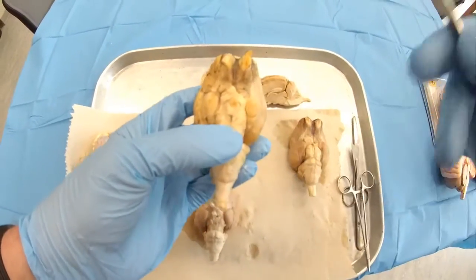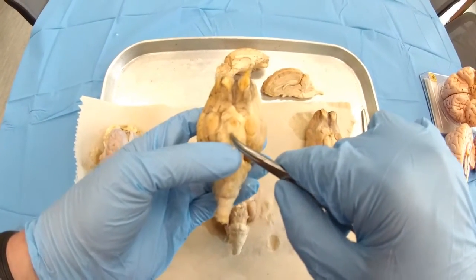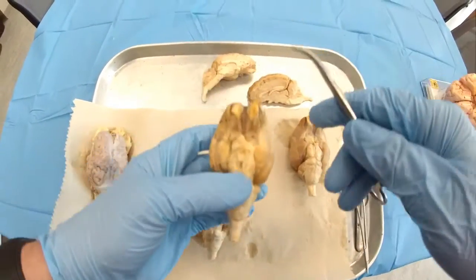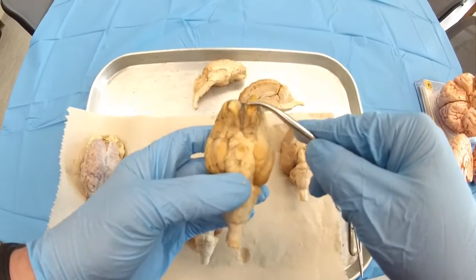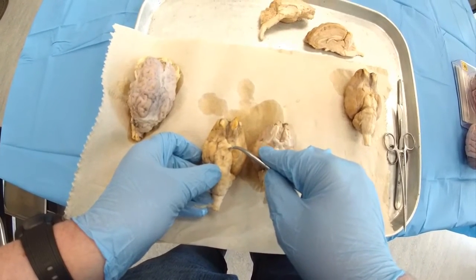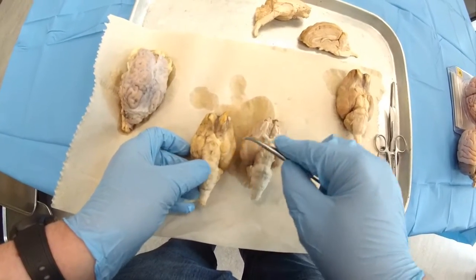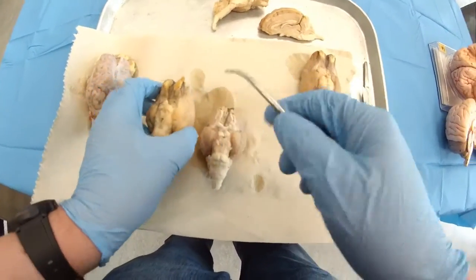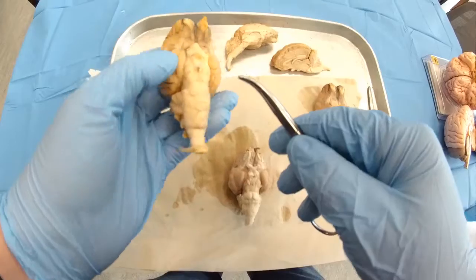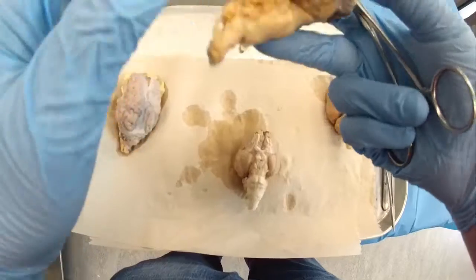Mammillary bodies are actually the lowest part of the fornix, and this is the representation of the limbic system. So practically the order: olfactory bulbs, optic chiasm, and pituitary gland, or master gland. And then next you get mammillary bodies. So that's the order, and this is what you observe on the base of the sheep brain. You could see actually the pons, cerebellum, and spinal cord.